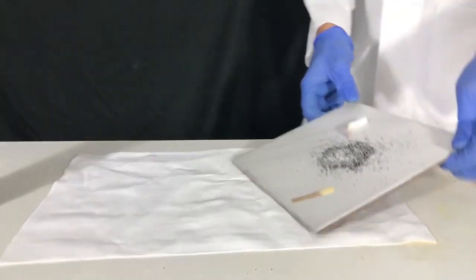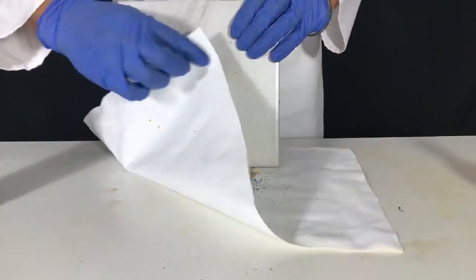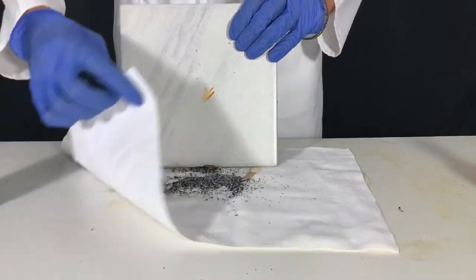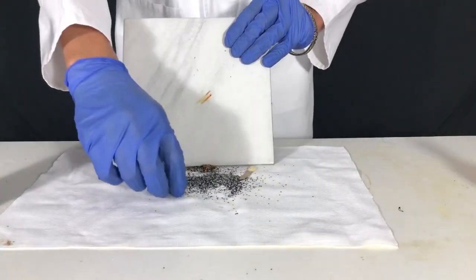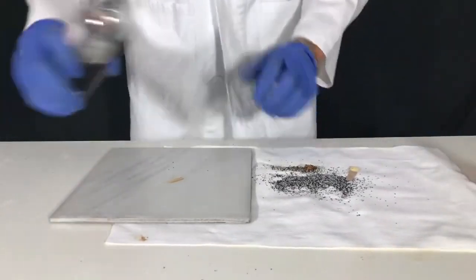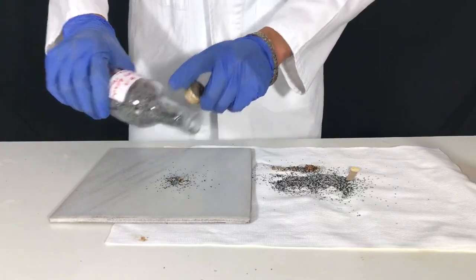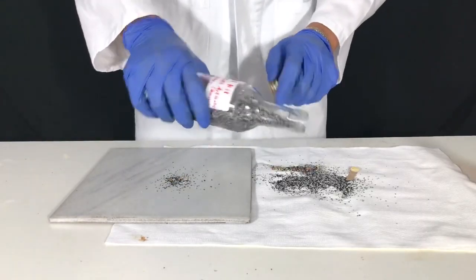Afterwards, the powder was dumped onto a towel. You can see that some of it continued to stick onto our tile. A little bit of bromine was still present. If you wait for 10 minutes after adding the powder, there will be no bromine left on the tile. But because I didn't wait, I simply put more powder onto the plate.